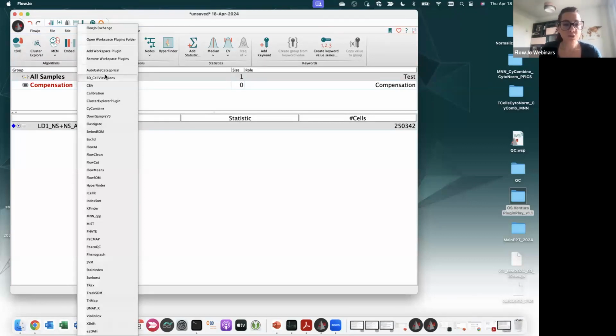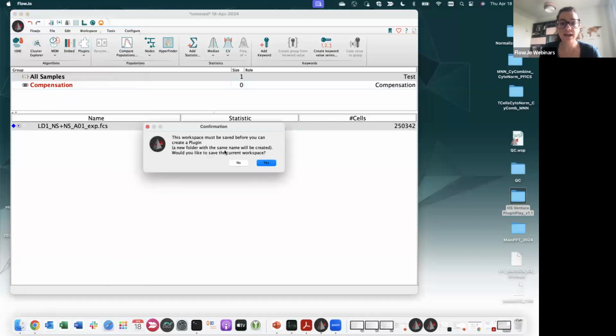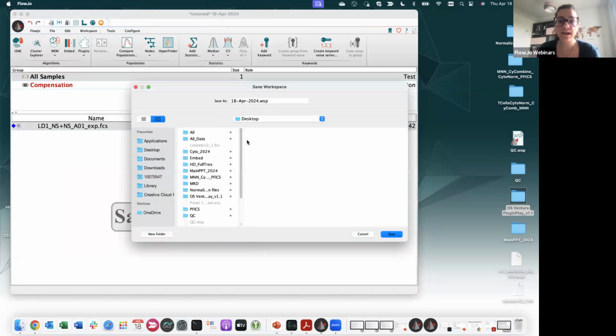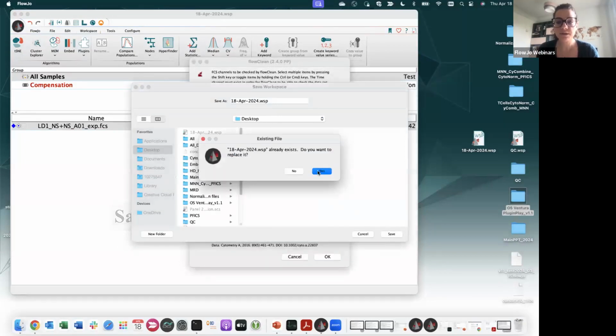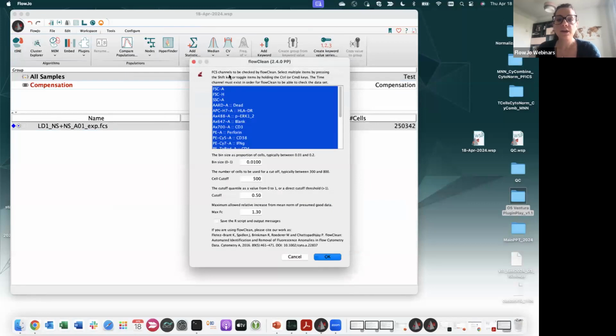But what you want to do is start running, for example, FlowClean, okay? And FlowJo will tell you this workspace must be saved before we go on. Please say yes, okay? And save it in a location which is local and not on an external drive while you're doing your analysis, okay? As you can see right here, you have a reference to the paper.